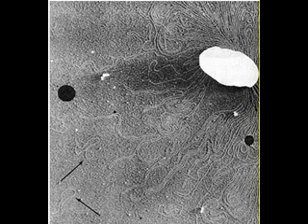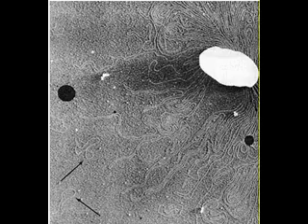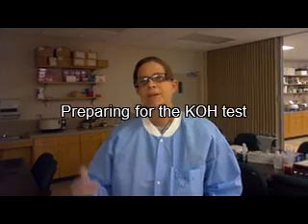On the other hand, the cell walls of gram-positive bacteria do not lyse and won't produce this reaction. The advantages of the KOH test are that it only takes a couple of minutes to do. You don't need a microscope, and it's not near as messy as the gram stain.